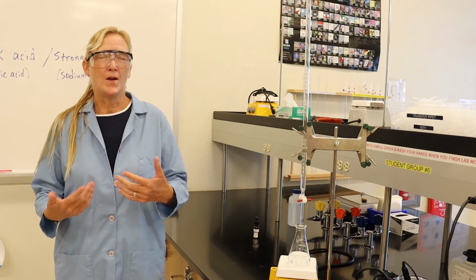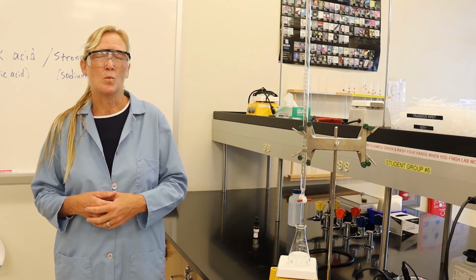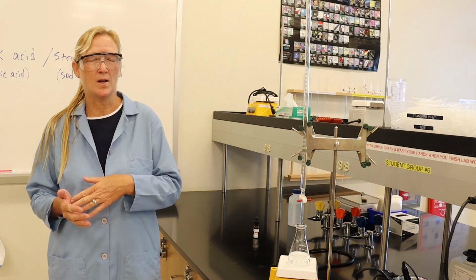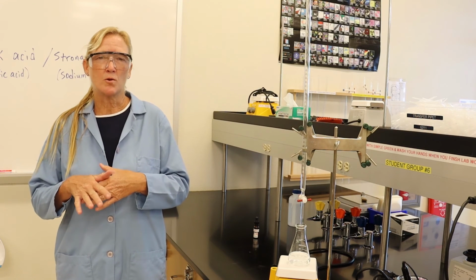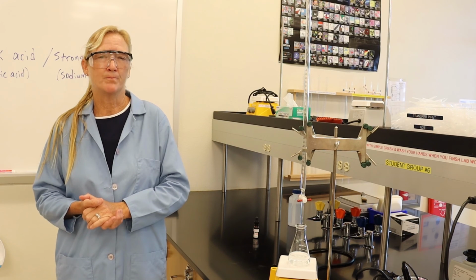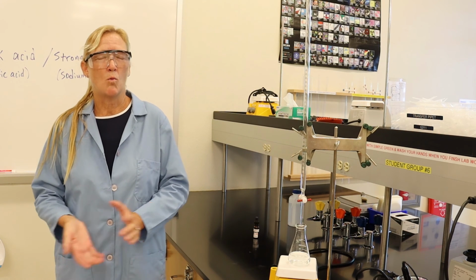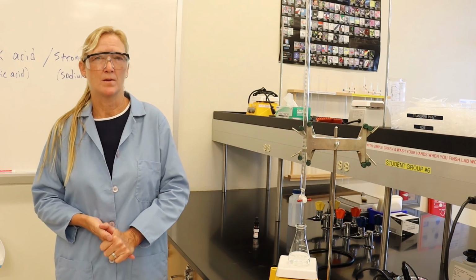So the next step is to take the data and graph it. We will want the pH on the vertical axis and the volume in milliliters of sodium hydroxide added on the horizontal axis. You should see a good titration curve. You find the equivalence point, and with this curve, we can then calculate the Ka value for acetic acid. And we'll walk through the calculation in our next step of this video.